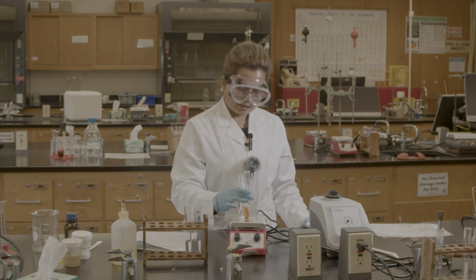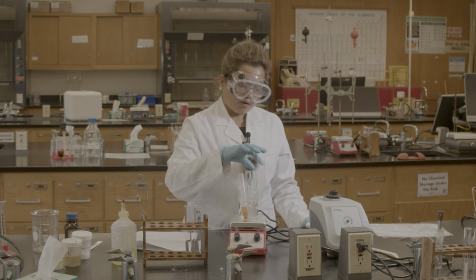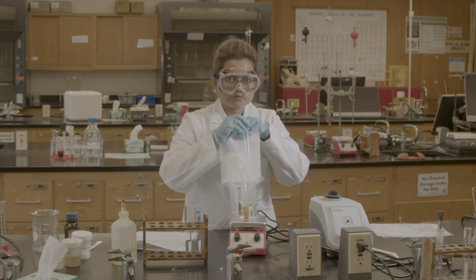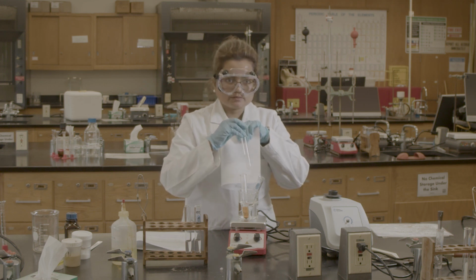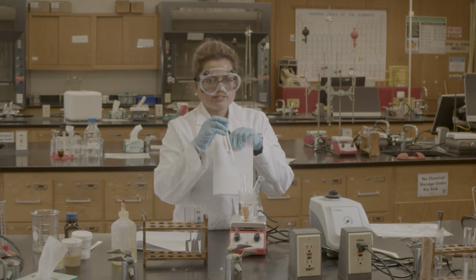I made a hot bath of these three, which were insoluble in the cold water. So now I'm going to check. This is my oil with the water. Still you can see the layer, right? That means if you increase the temperature, it doesn't matter. Oil never dissolves in water, because water is polar and oil is non-polar, so they never dissolve in each other.